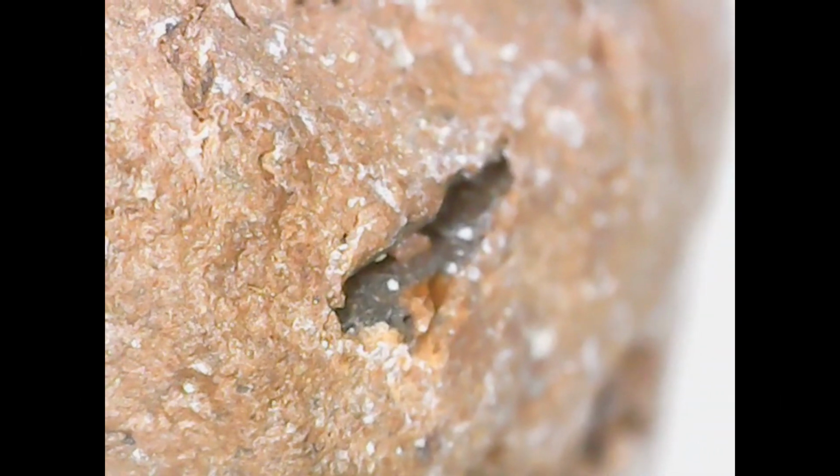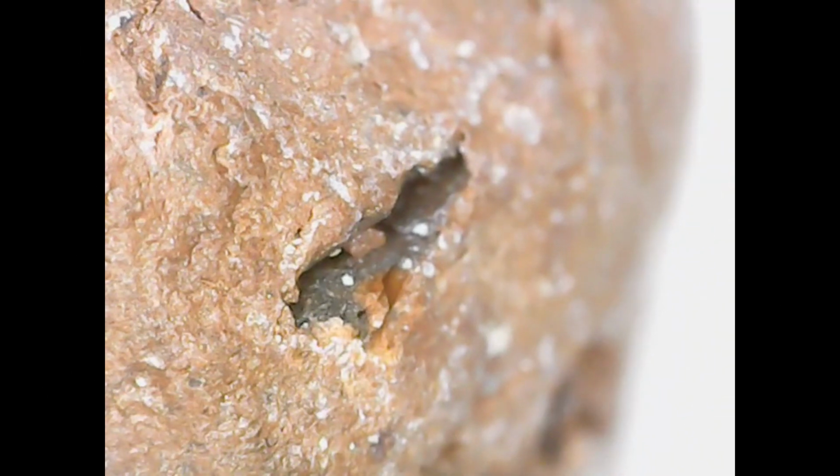So in the dry form, you can see here what the surface looks like of the Leca as well. There's some white sections on there, which I'm not entirely sure what they were, but you could see some of the divots that were happening throughout that structure, and that's obviously what's going to hold on to the water. You can see there a bit of a heavy divot there.